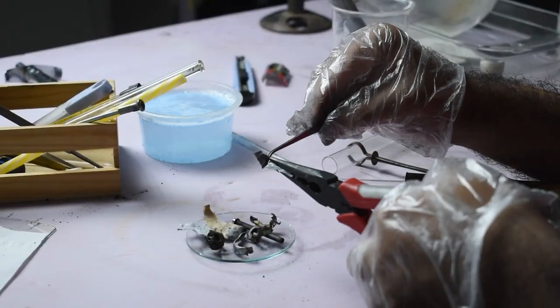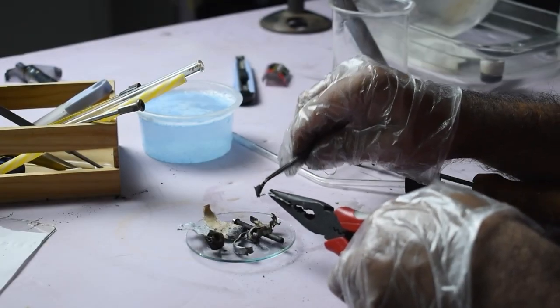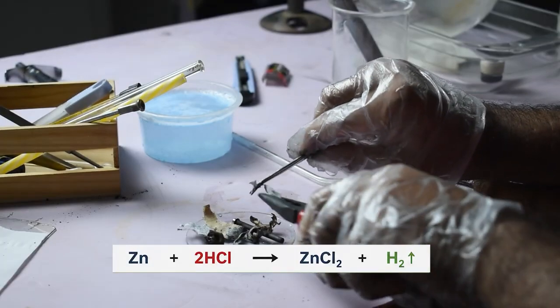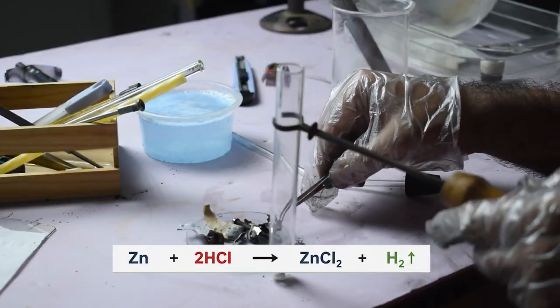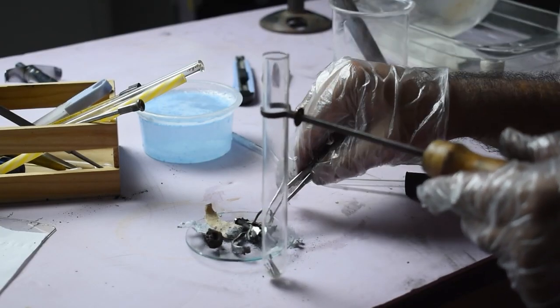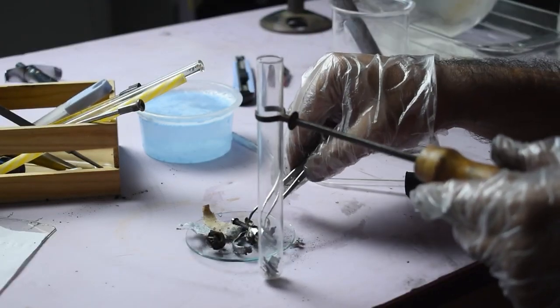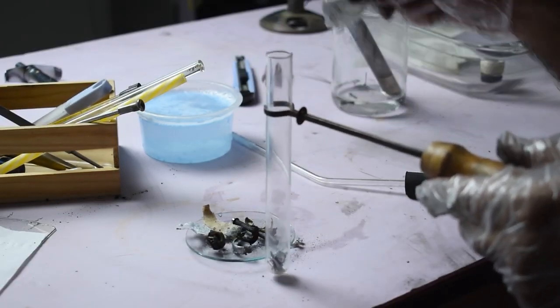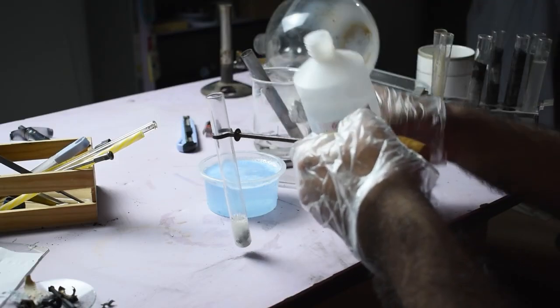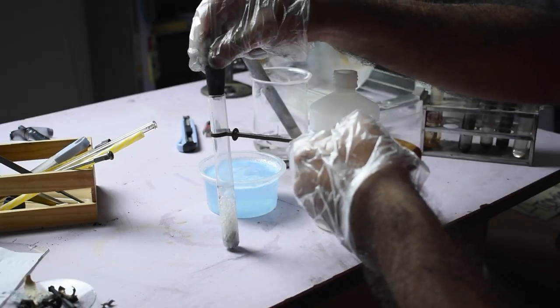Now let's use these materials to produce and identify three different gases. First, let's generate hydrogen gas. One of the characteristic properties of many metals is that they react with acids to release hydrogen gas. To demonstrate this, we place small pieces of zinc into a test tube and add hydrochloric acid. Almost immediately, bubbles begin to form as hydrogen gas is produced.